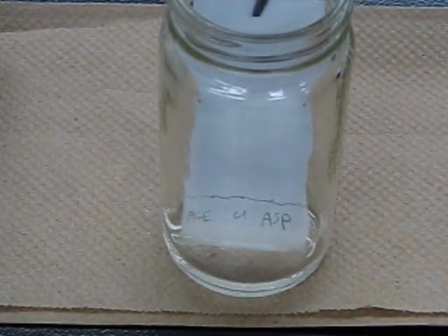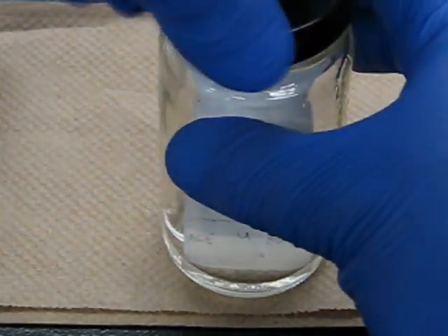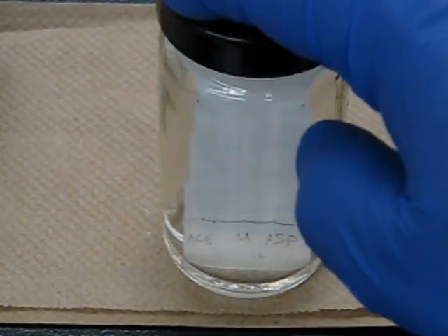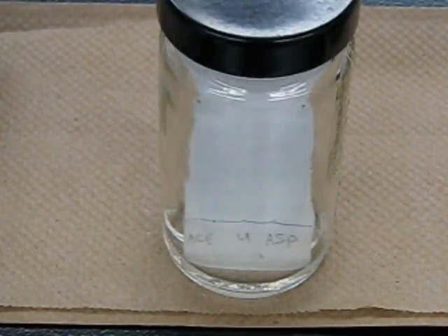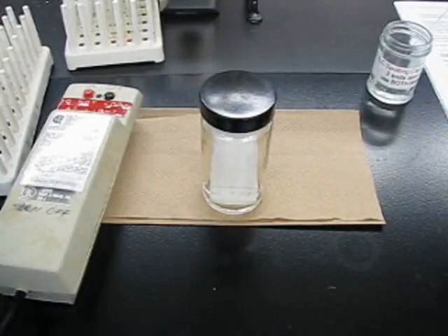Drop it in - if there's room, you could even push it a little more to the edge where the solvent might be deeper. Put the lid on, and now you wait. But make sure you keep the jar level on the bench; don't pick it up and start waving it around.